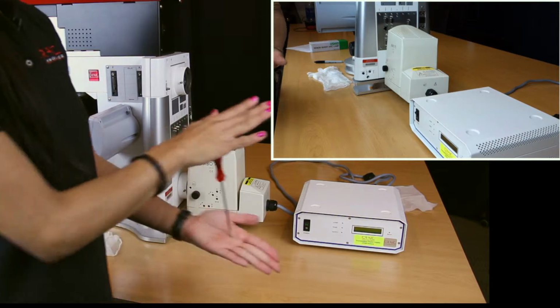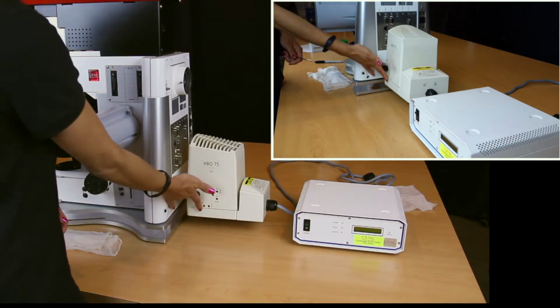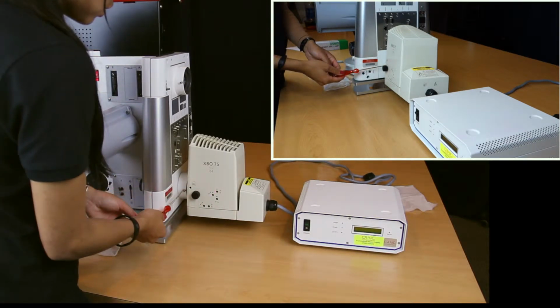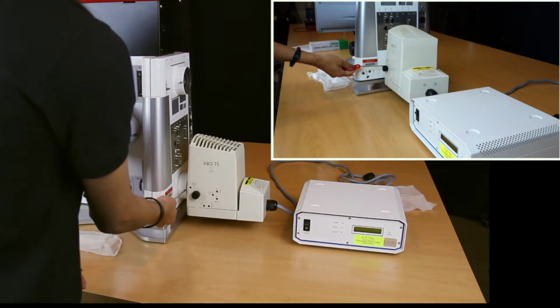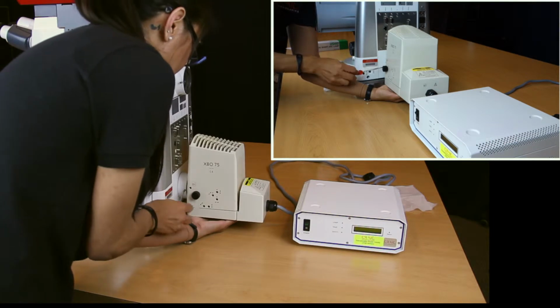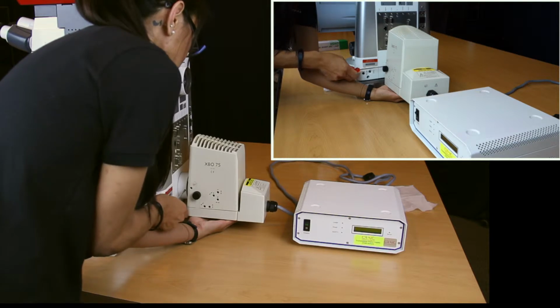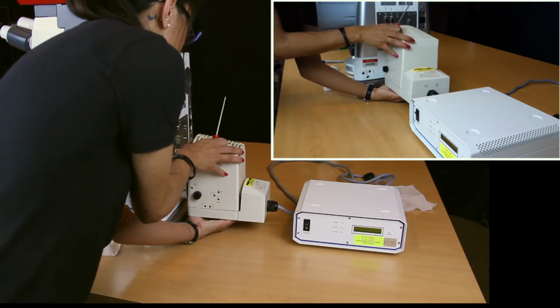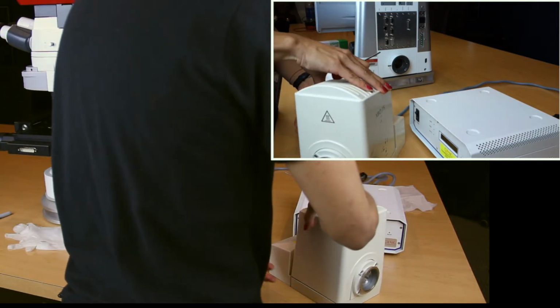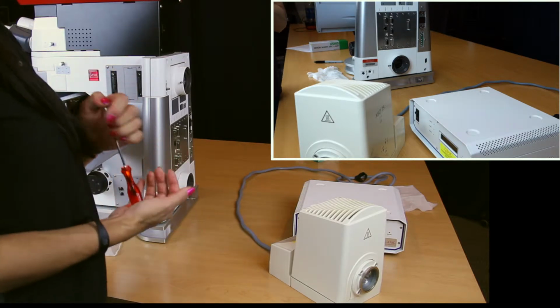So what you would need is your 3.5 millimeter Allen tool wrench. And you have to locate the set screw just behind the unit. In order to remove the set screw behind the unit, you want to twist the set screw in a counterclockwise position. Meanwhile, you want to also support the lamp housing with your other hand, as the unit will actually fall onto your hands as soon as the unit becomes loose. Once loose, you want to go ahead and remove it and set the lamp housing on a flat surface. And in the next segment, I'll go ahead and show you how to remove the lamp bulb from the lamp housing itself.